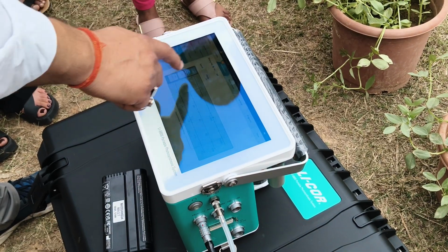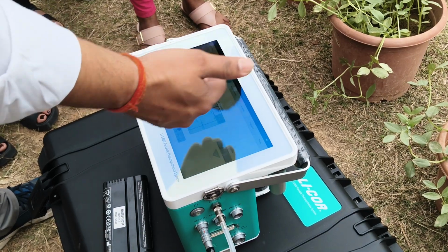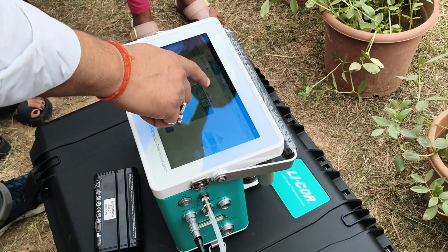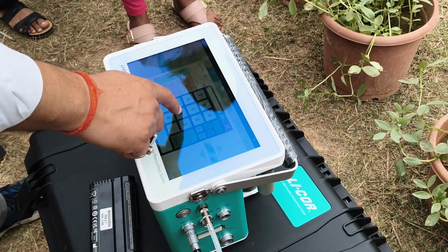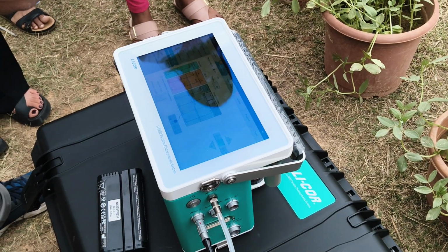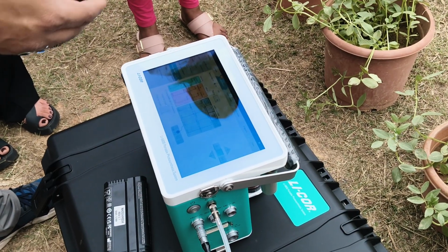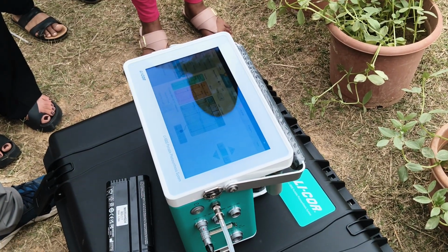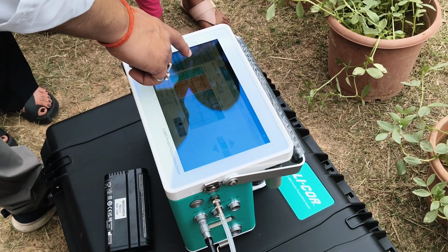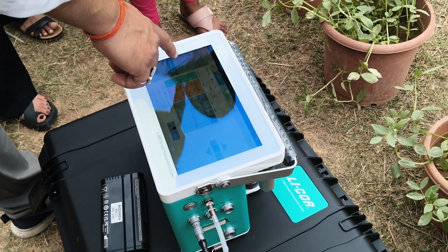Then you can switch on the fan. Fan should be 10,000 RPM. Temperature should be similar to ambient, so it is around 25. So I just switch on and change this to around 25. It is also dependent upon your experiment. If you want to check any temperature variation in your plant, how it affects the plant also, you can change plus or minus 10 degrees Celsius above or below the environment temperature. And in CO2 you can make a CO2 response curve from 0 to 2000 micromole.